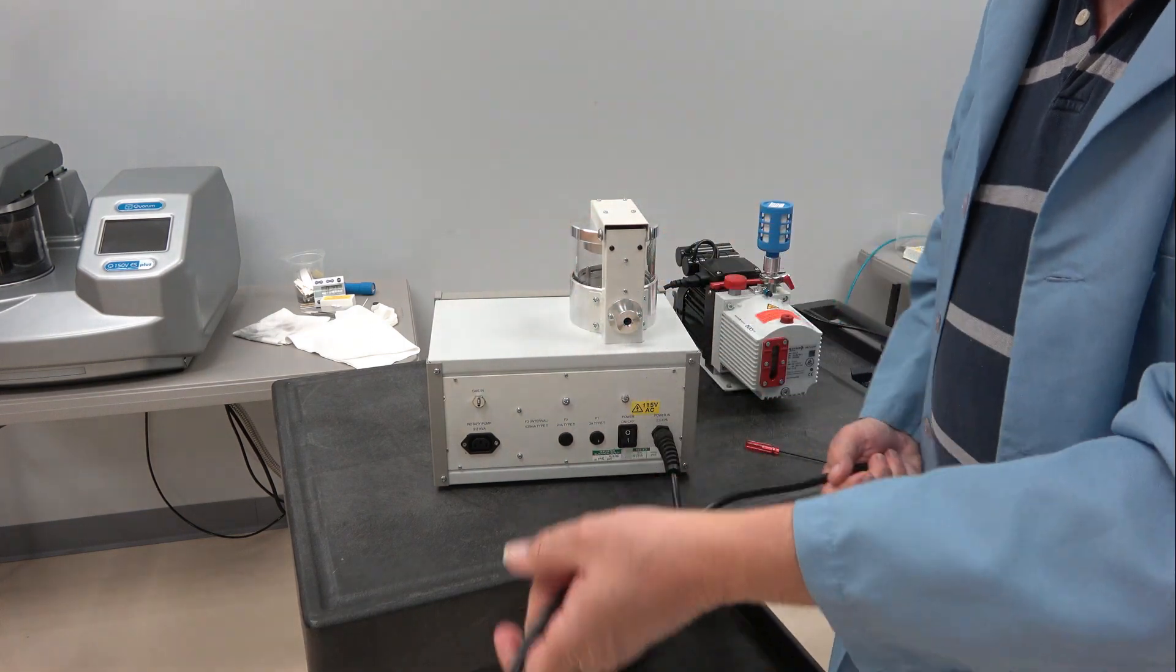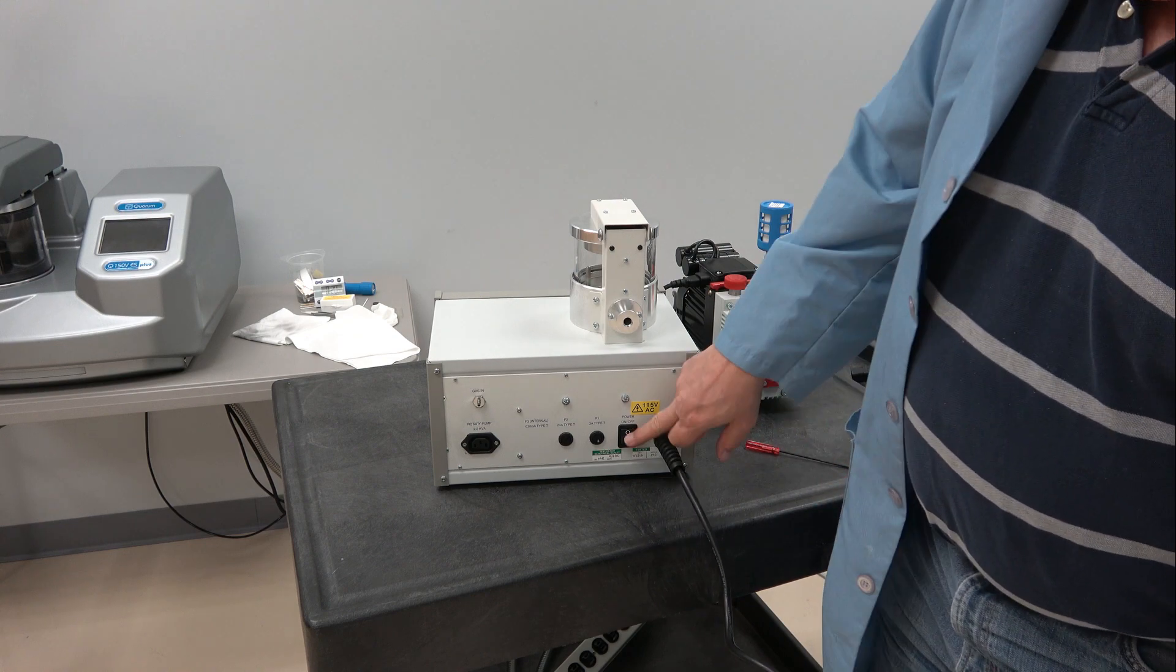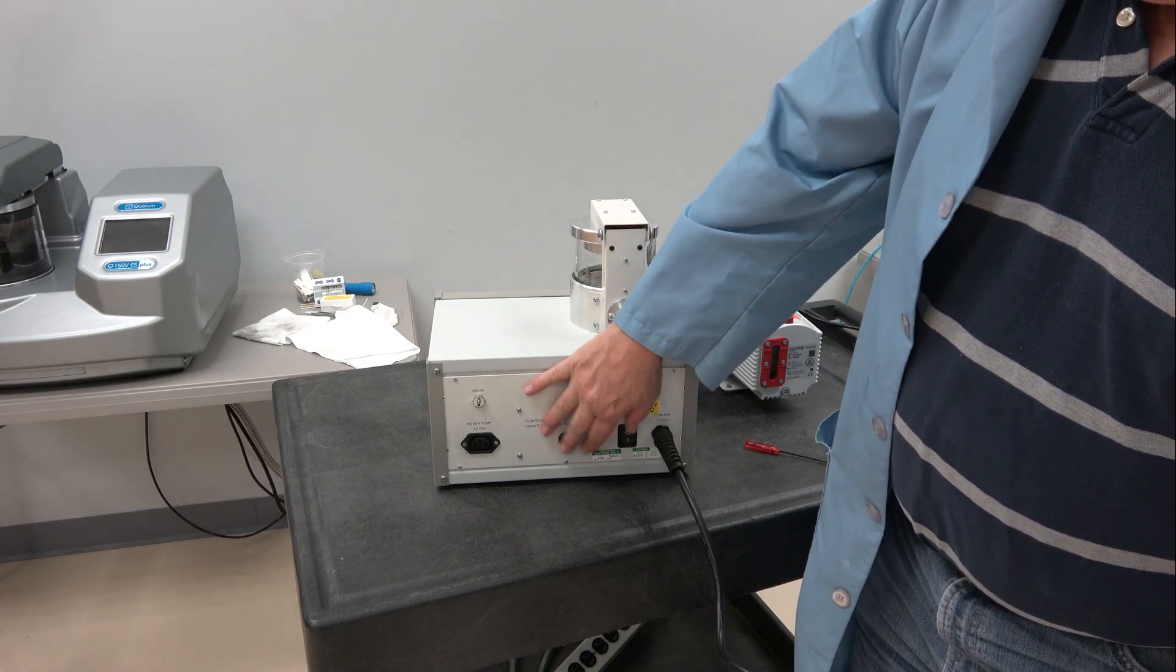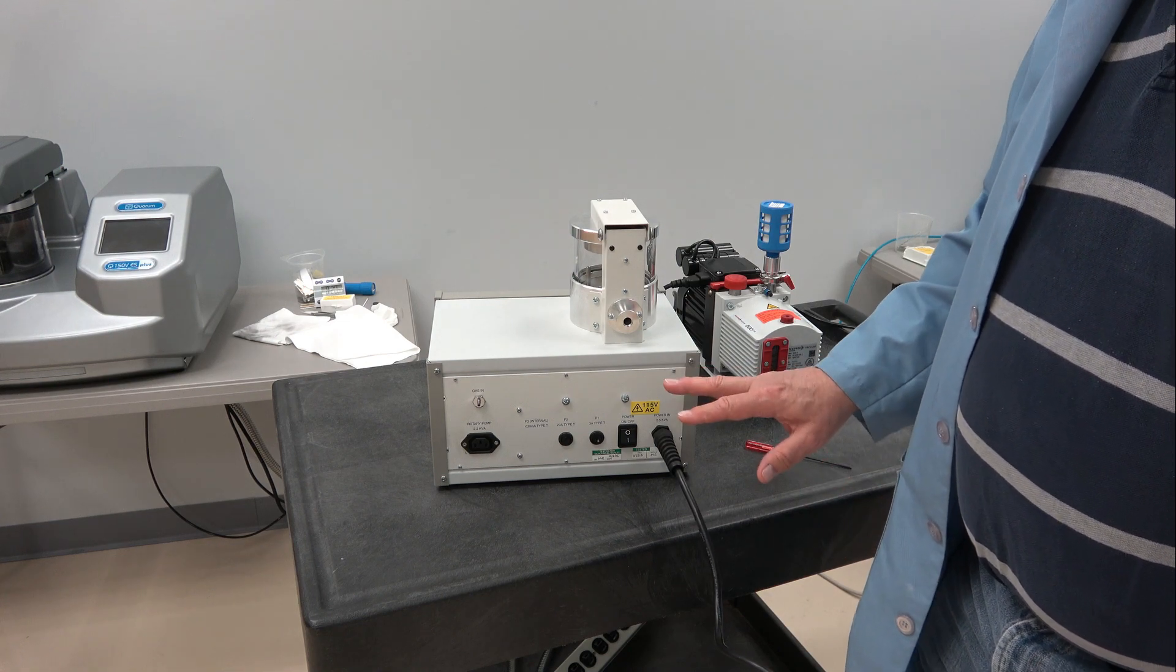We have the mains cord which gets plugged into an outlet. We have the on-off switch. We have two fuses which we hope we never have to change.